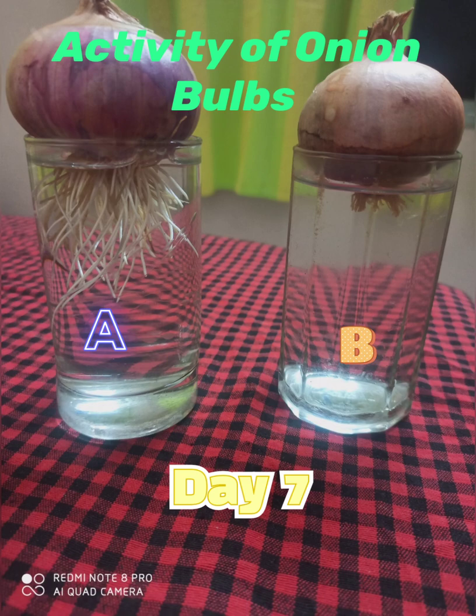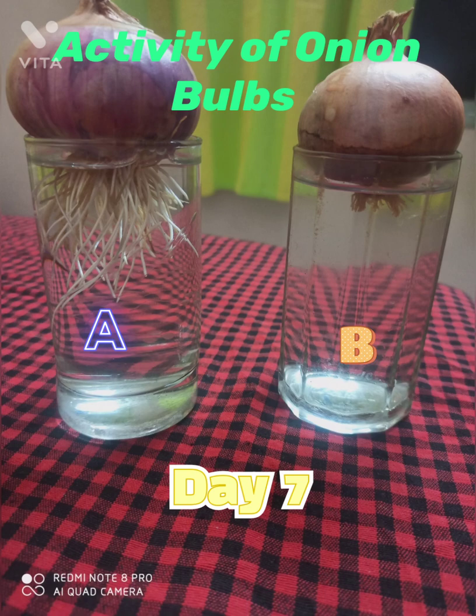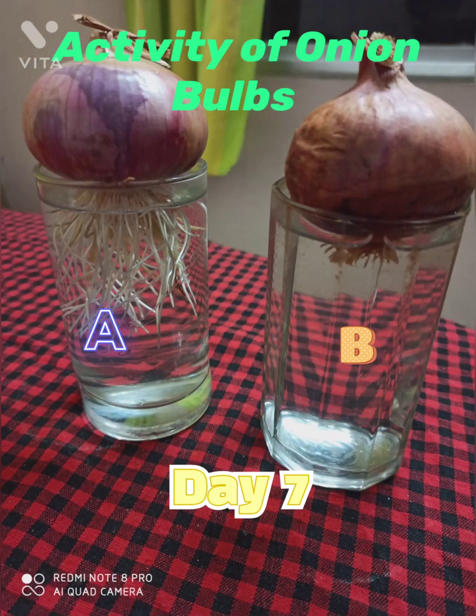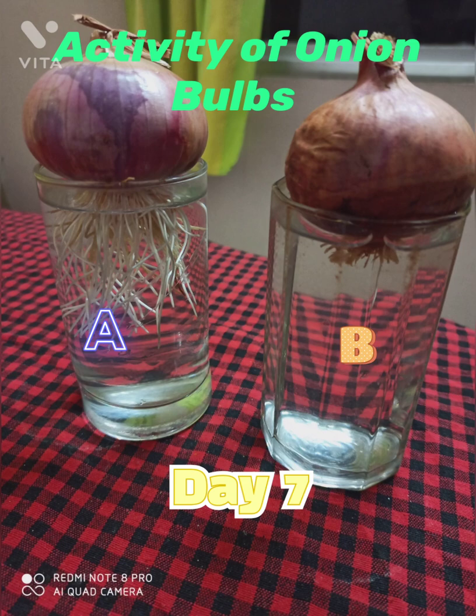This is the observation on day 7. As you can see, the roots in beaker A are growing much rapidly, whereas the roots in beaker B are not growing because the root tips have been cut. You can compare the differences in the length and size of the roots in both cases.